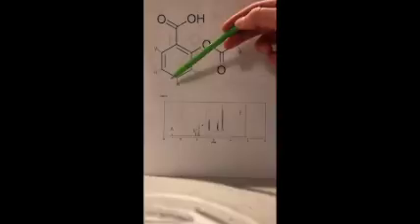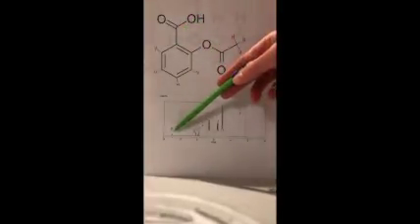Then for the integration for this compound, it's not labeled on this spectra, but we can make an inference based on the relative heights of the signals. So E here corresponds to these 3 hydrogens, which makes sense, it being the tallest peak because it corresponds to 3 hydrogens. And then here, B, C, and D, we can see on the zoomed in version, this signal D is slightly higher because it corresponds to 2 hydrogens, and then B and C are about the same height because they both correspond to 1 hydrogen. And then A is also another short peak because it corresponds to 1 hydrogen here.